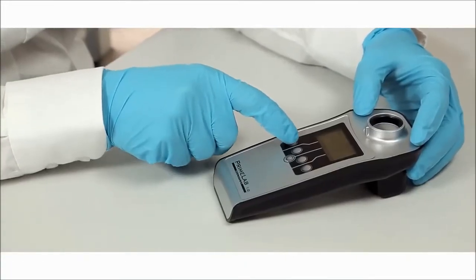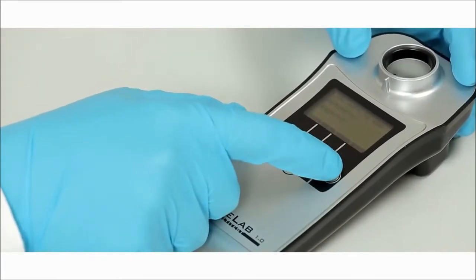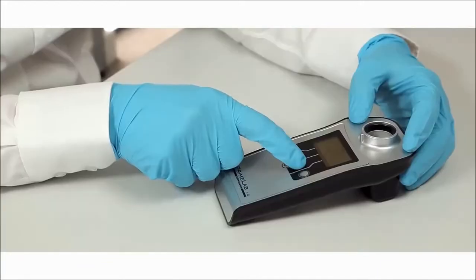Click test on the PrimeLab and press the down arrows to scroll through all of the standard testing guidance. Click OK to go to the accounts page.